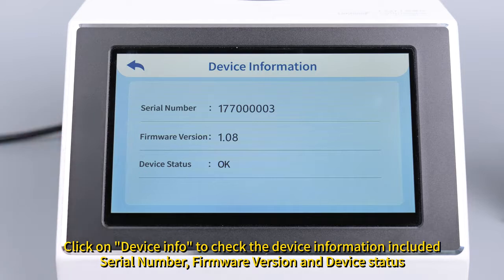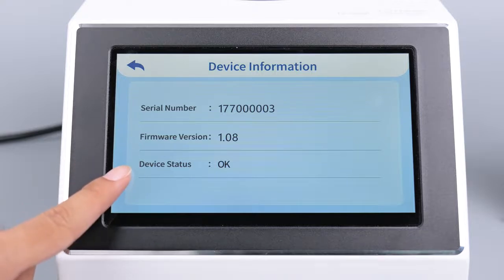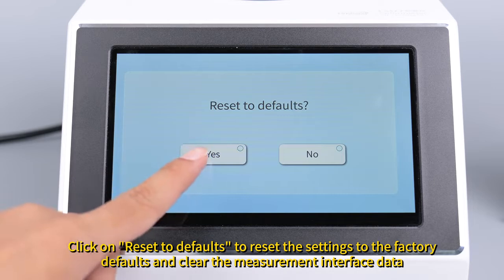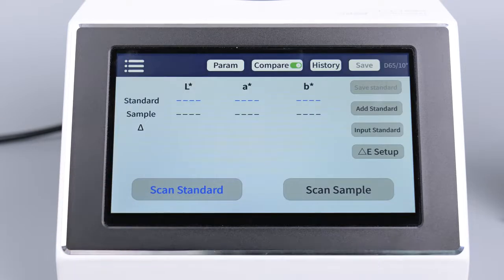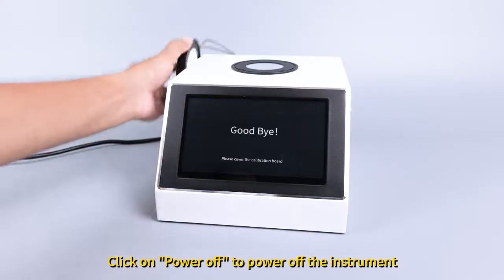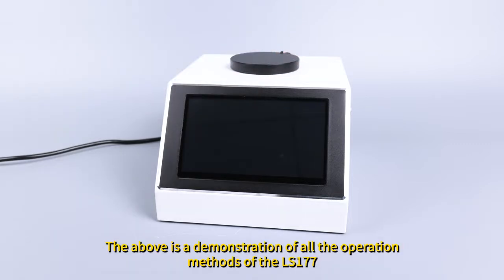Click on Device Info to check the device information, including serial number, firmware version and device status. Click on Reset to Defaults to reset the settings to the factory defaults and clear the measurement interface data. Click on Power Off to power off the instrument. Please cover the calibration board. The above is a demonstration of all the operation methods of the LS177.